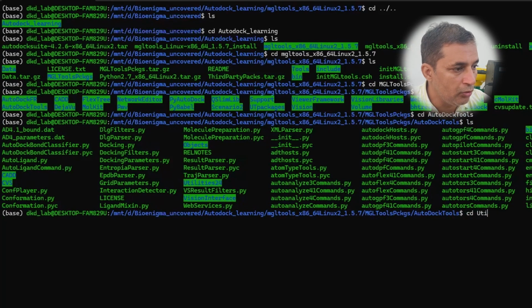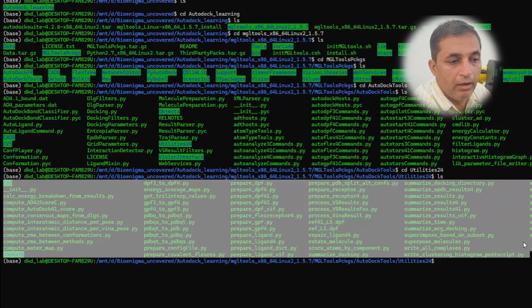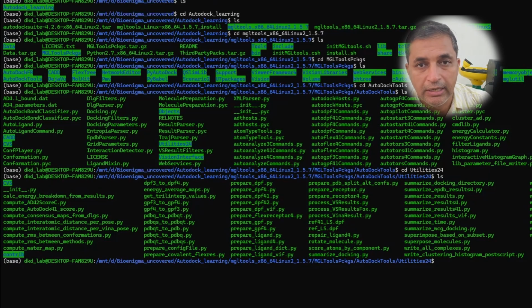Again, we are going to move to another subfolder here, that is utilities 24, to further verify whether the installation is successful or not. I am going to type ls command and hit the enter button. You can see various Python files within this subfolder, which basically establish that our installation has been successful.